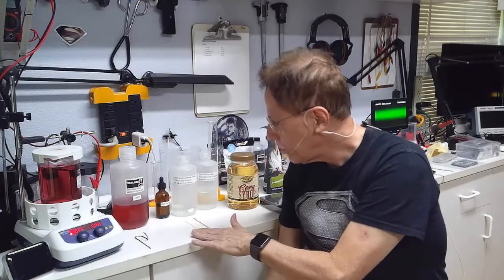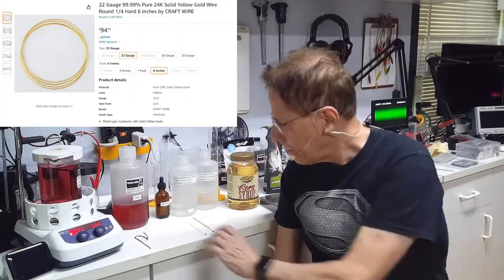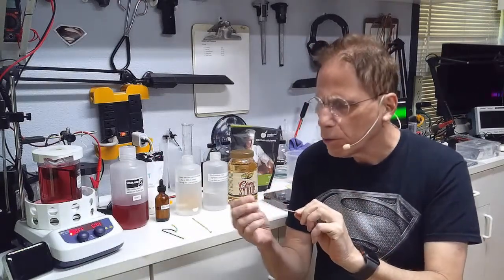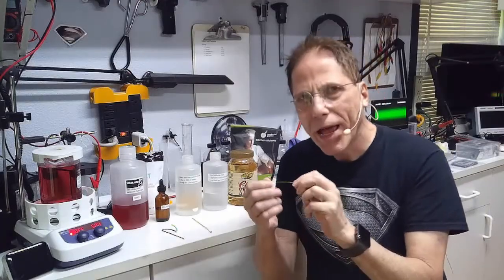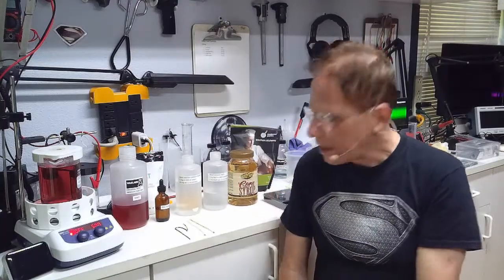The gold rods I get on Amazon must be 24 carat — 14 carat does not work. You can also use a 24 carat gold coin if you have one. I use wire: roughly a 24 gauge wire will last you about 60 batches of 500 milliliters of colloidal gold. Eventually it becomes too thin and you'll have to buy another piece and twist them together, as I've done here.